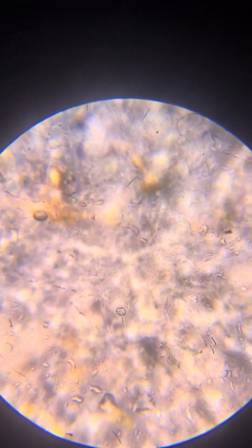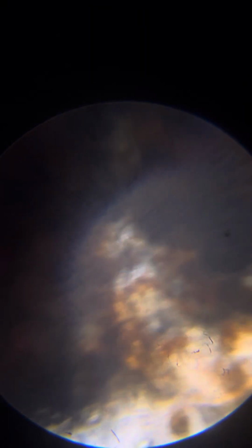Difficult to focus. Maybe that's train. I'm not sure. And yes, as a lesson learned, to make the test samples with less material, more thin and transparent, so we can focus on the stuff.